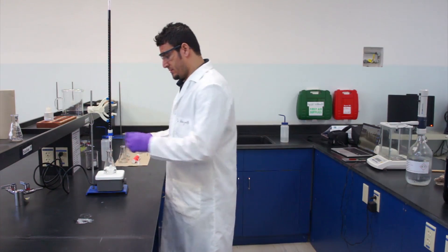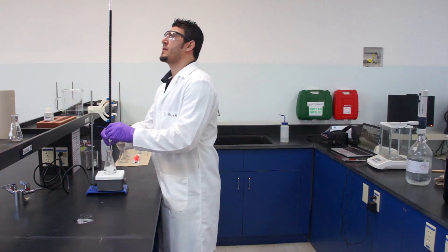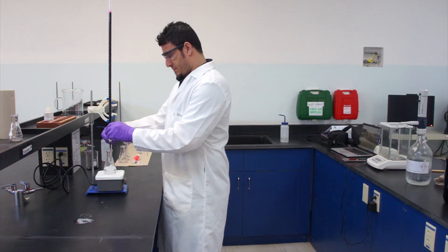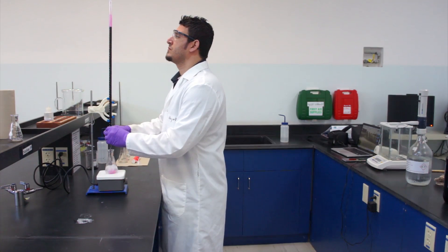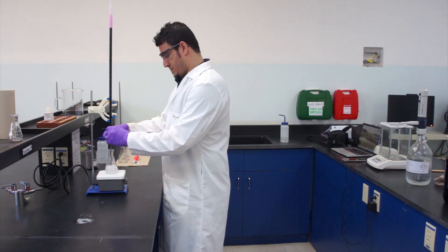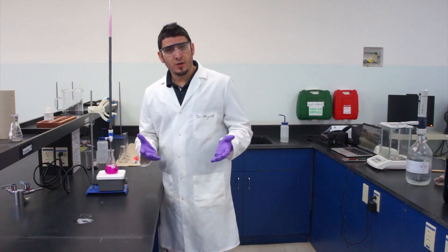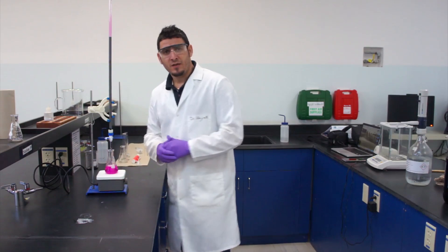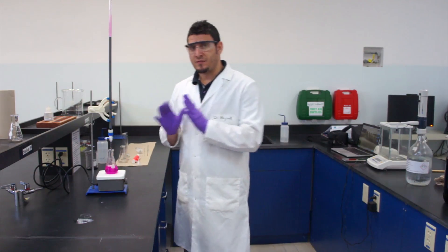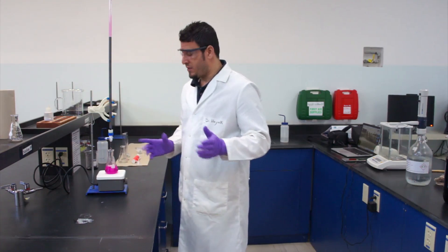For the rough titration, I will add potassium permanganate one drop at a time until the color changes. After adding 11 mL, the color has changed — but this is for my dilution factor. For your dilution factor, it might take less or it might take more.